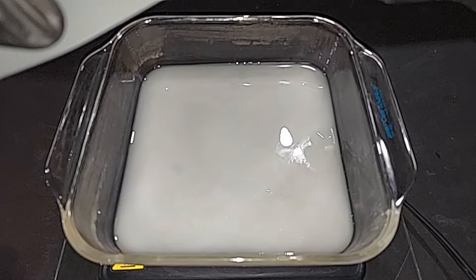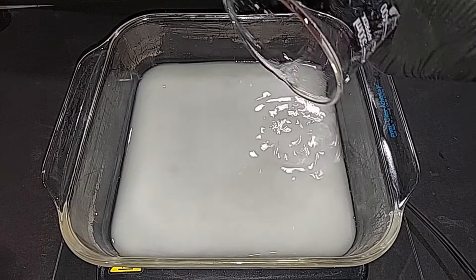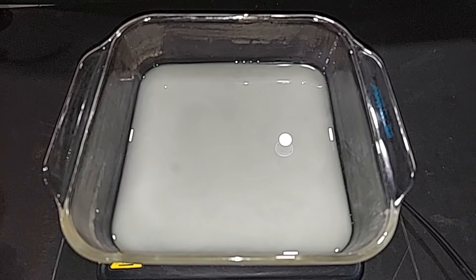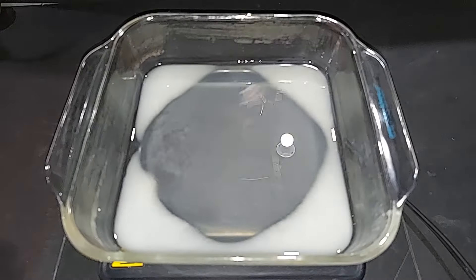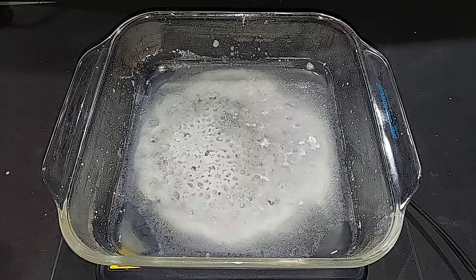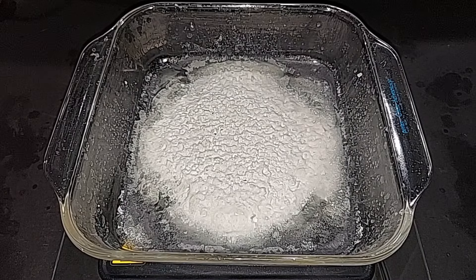Turn on the heat. Just one more thing about this step — this is where the ammonia gas gets released; there will be quite a bit of it, so it needs to be done under a fume hood or outdoors. Here's our sodium nitrate almost completely dried out, but it's going to take a couple more minutes — I can still hear a few crackles as the last bits of water dry up. Once this cools down we'll scrape it together; we only have one last step left, which is to wash it with acetone.